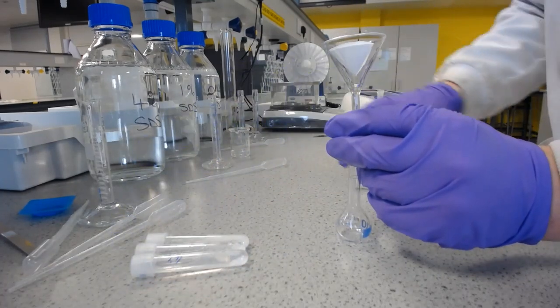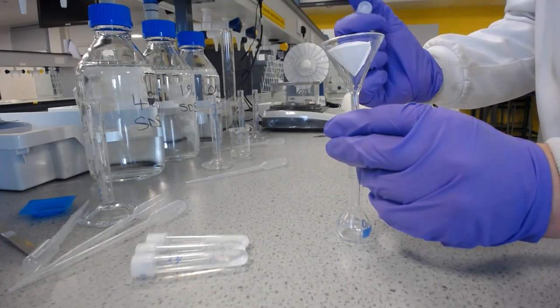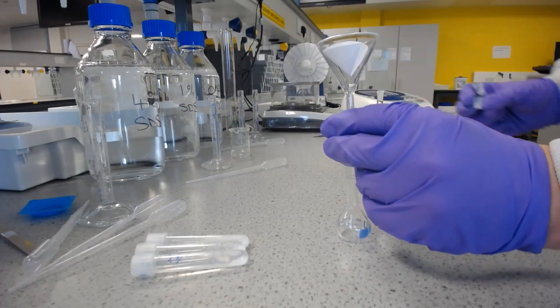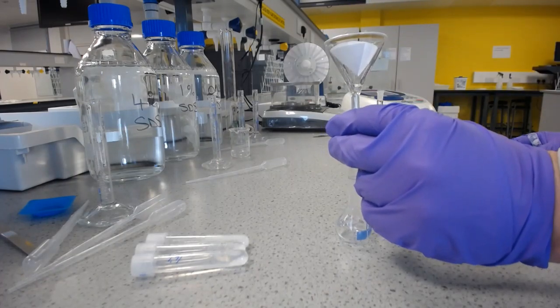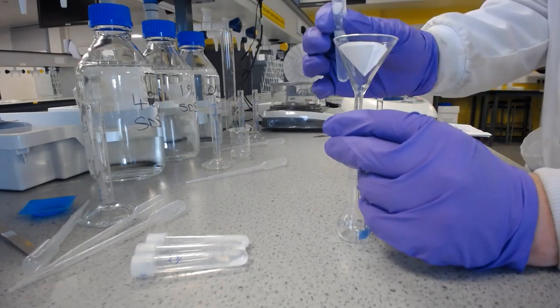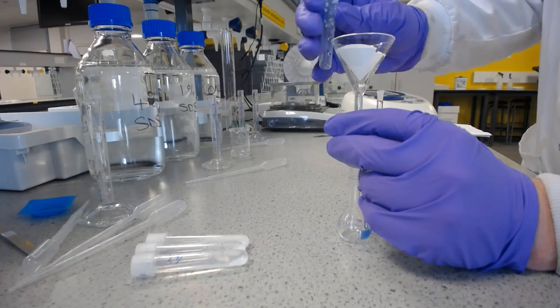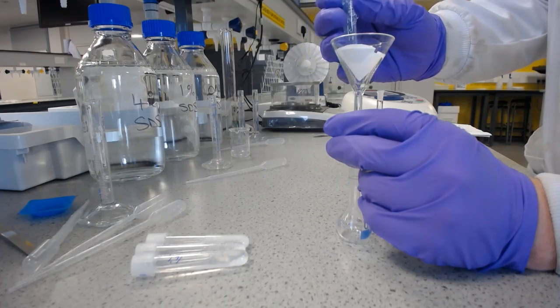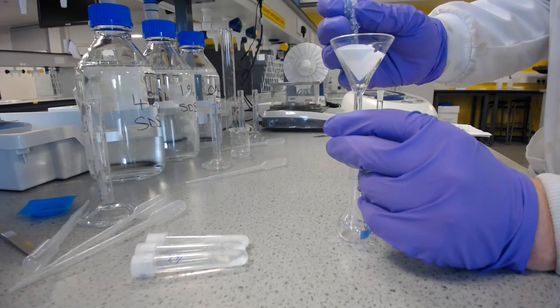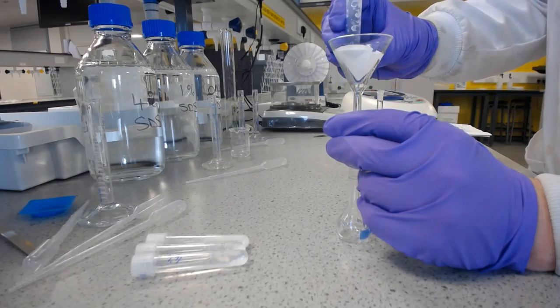Now I'm going to do this with just one on the video, and I'm going to do that with water, but the same process will be repeated with this and with the dilution for all of them. So just pour this, make sure it goes through the filter paper, and then it doesn't go over the tops and sides of the filter paper. Now this will be a relatively slow process.